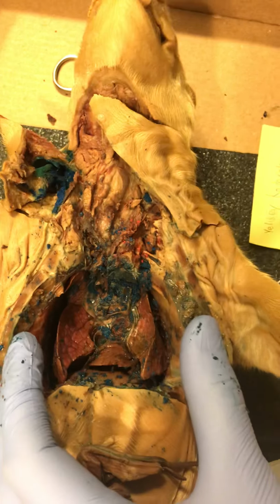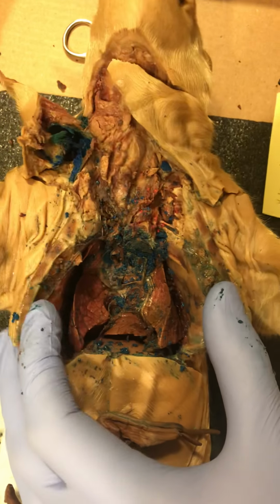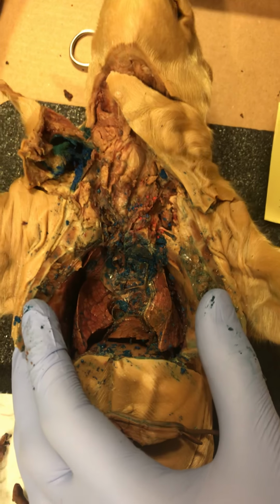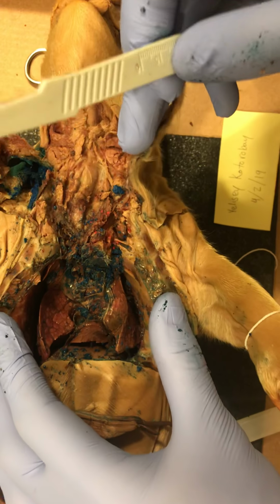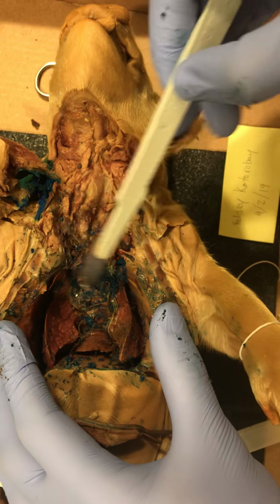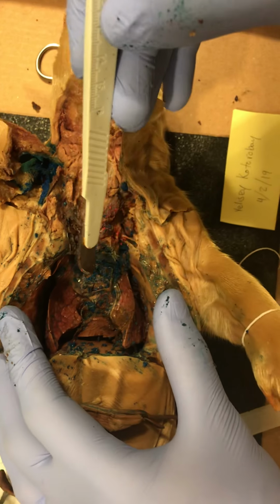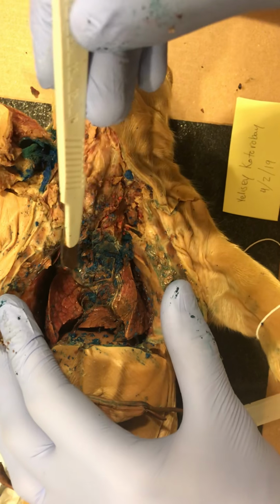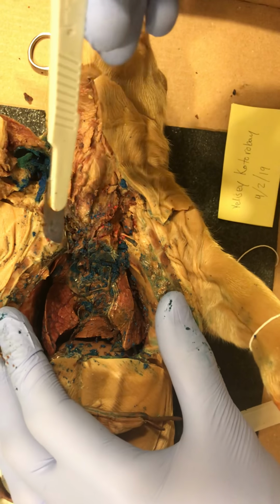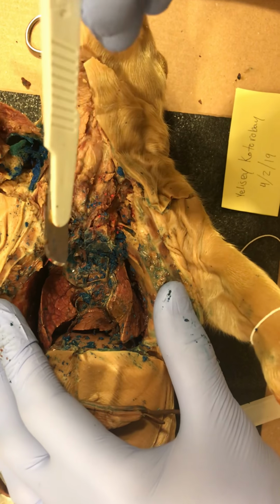Good. All right. So the respiratory system is very simple for us. Just to do a quick play-by-play, we're looking at the various lobes. The top ones are called the apical. The ones to the side in the middle section are the cardiac lobes because they were pretty close to the heart. And the bottom ones are called diaphragmatic lobes.